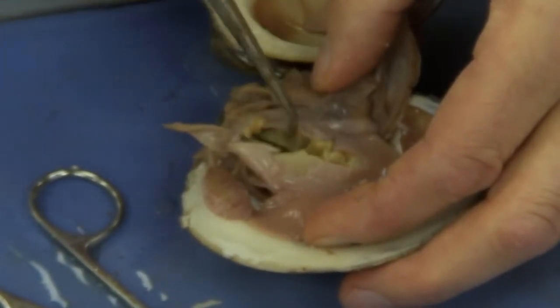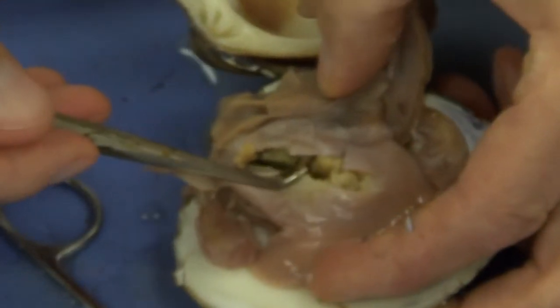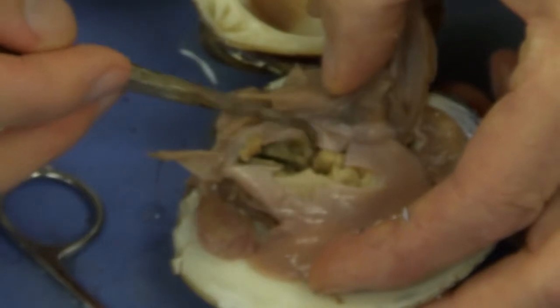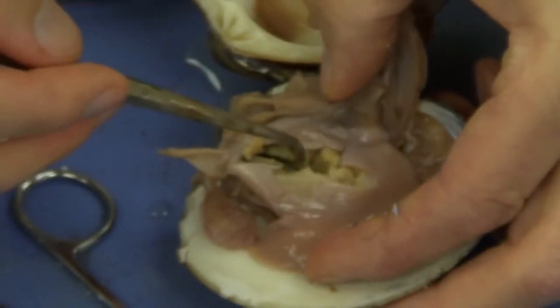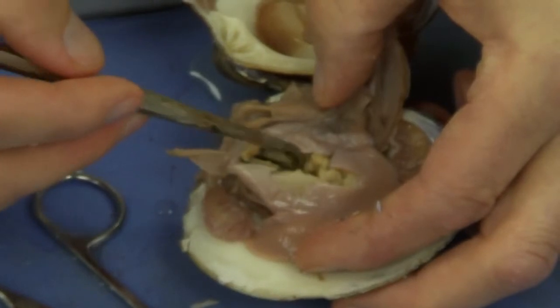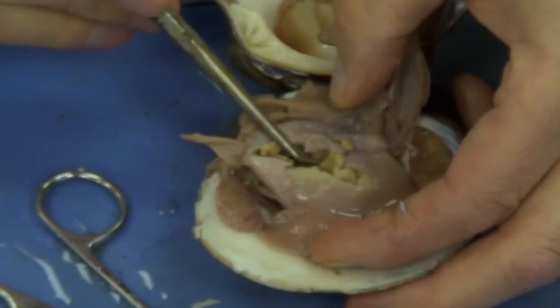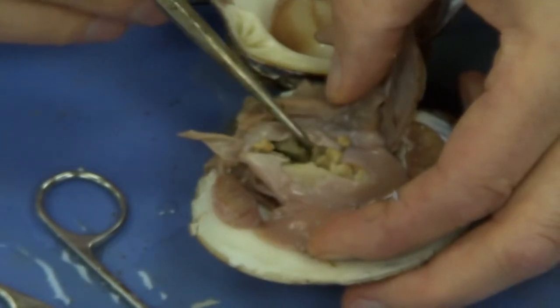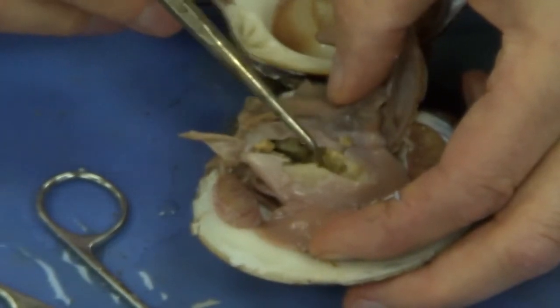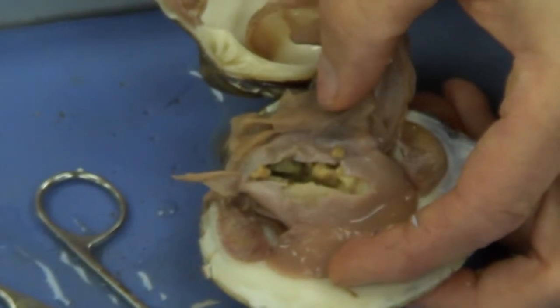I saw a little tube right there. There's a piece of tube. And this tube is going to be coiled, and that's the intestine. So poke around a little bit as best you can without damaging things, and look for a tube, or even 2 or 3 tubes. And when you see that tube, you know you're looking at the intestine.